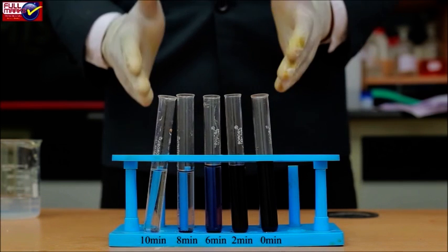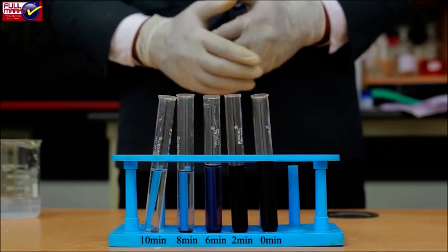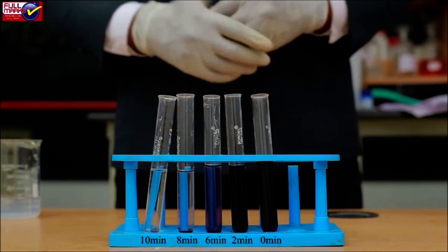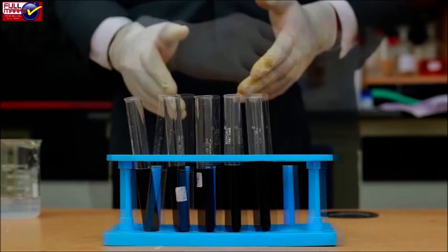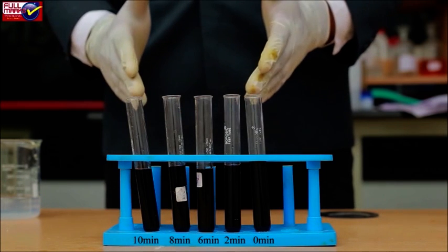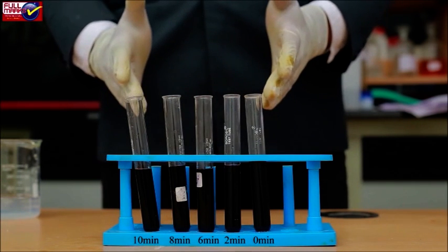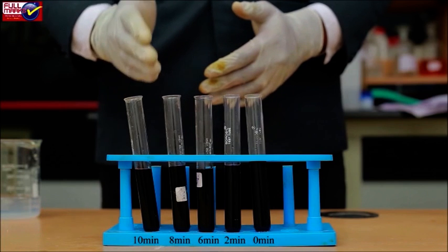After an interval of 2 minutes, again take a drop from each of the tubes and add to the iodine tube and note the changes in color of iodine. Keep on repeating the experiment at an interval of every 2 minutes till color of the iodine does not change.